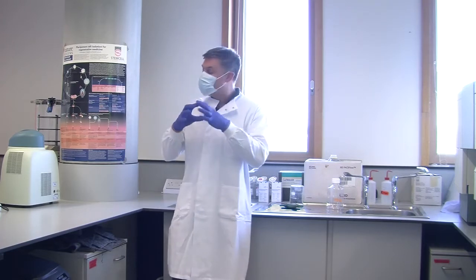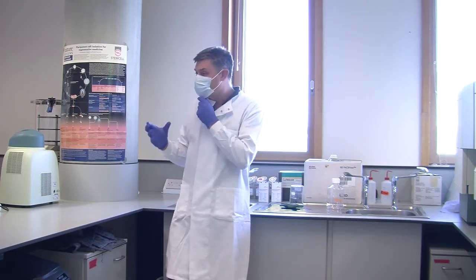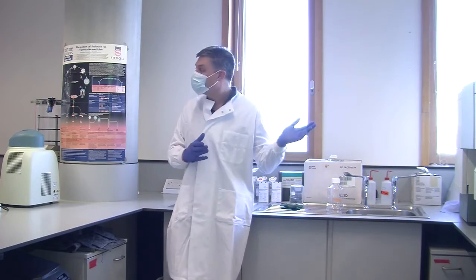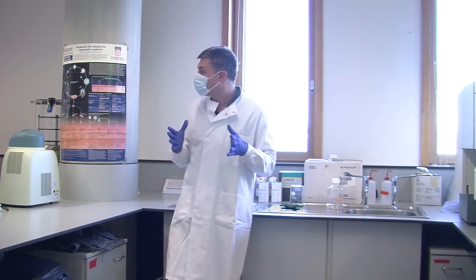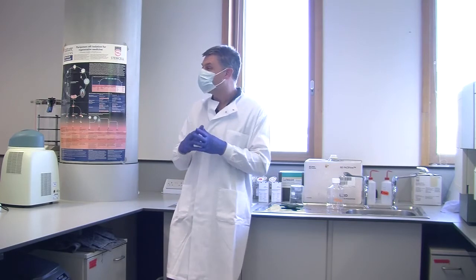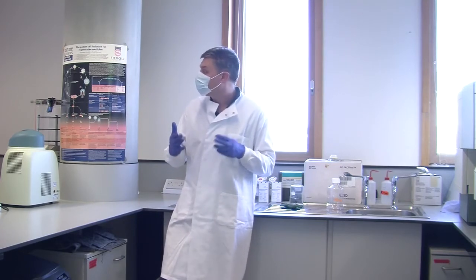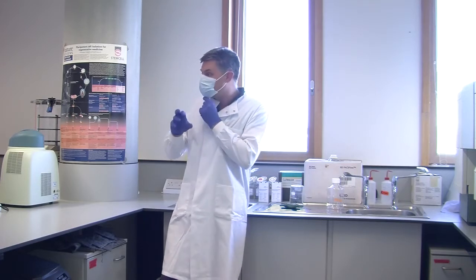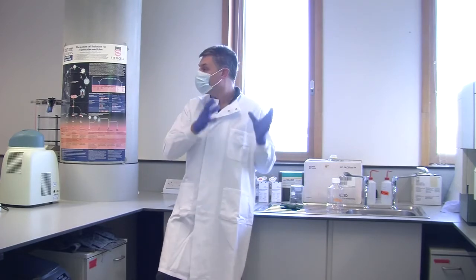And microscopy can give you very detailed information about individual cells. What you can't do is look at large numbers at any one time. The flow cytometer can look at, well, this one won't, but a more modern one will look at maybe 20,000 per second. So if you've got very rare cells, you can still look at 2 million cells, 20 million cells in a fairly short time and look at how much protein they have rather than relying on the entire population. So it's a very, very powerful technique.